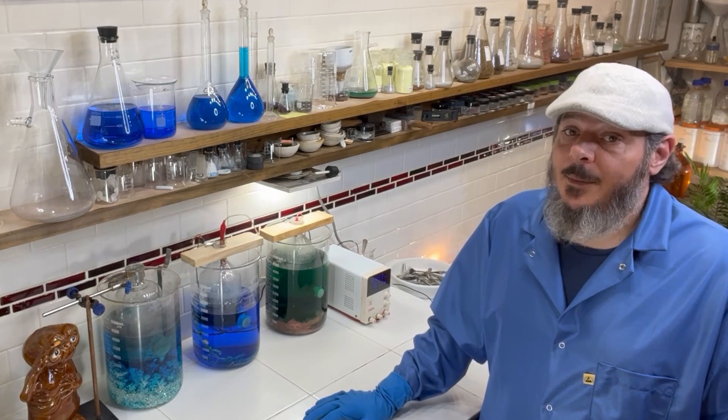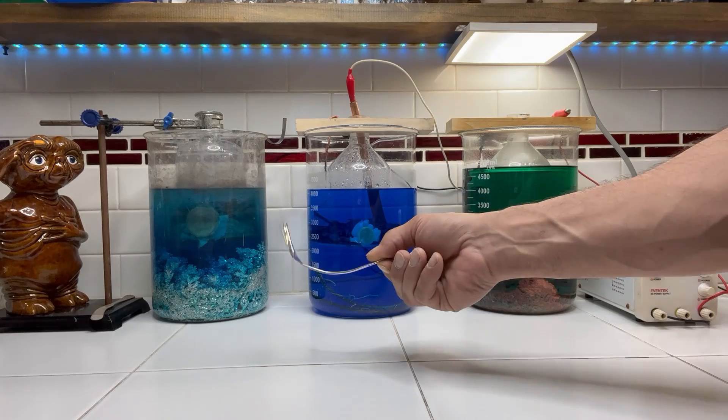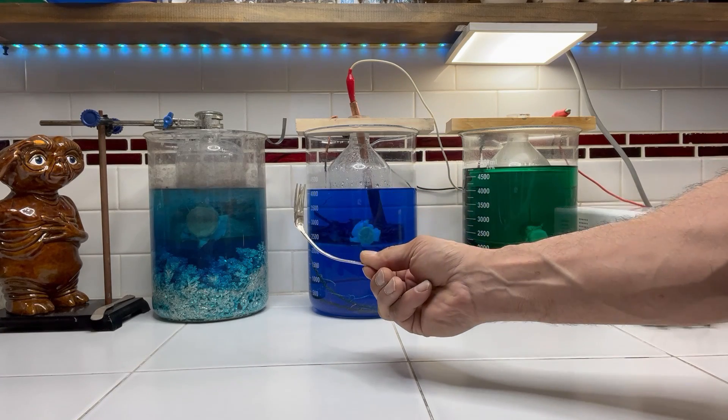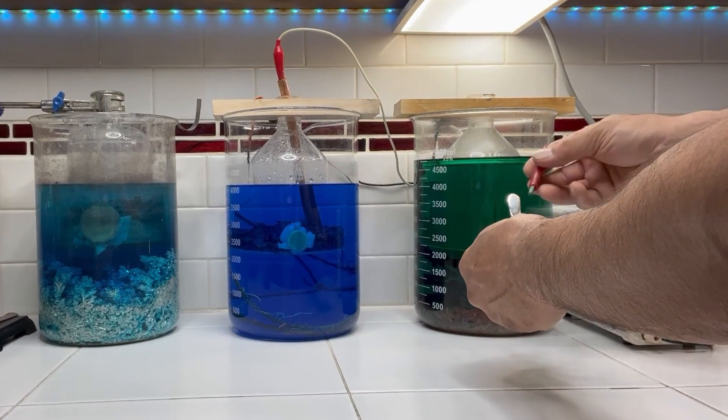Welcome to the lab. I'm Anthony Thomas, and here's what I've been up to. I'm going to show the results of about three months of experiments refining silver plated items and then find out if any of these experiments are effective by using XRF analysis.